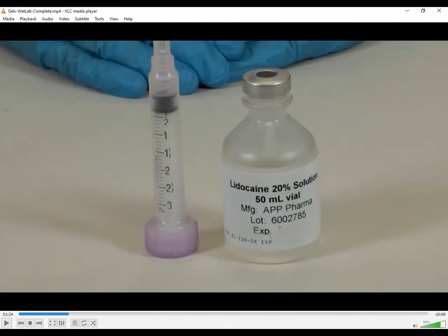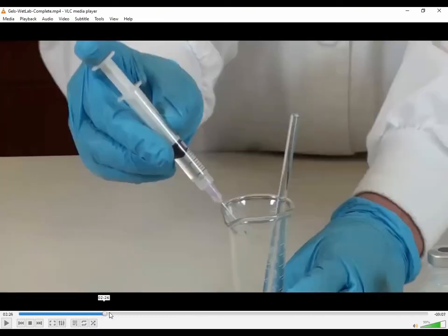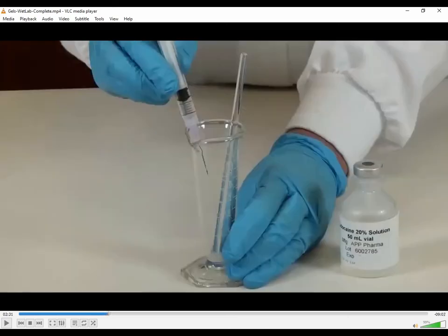You also are going to attach a needle. There is a longer blunt end needle. Attach that needle to the 3 mil syringe and use that to suck up the 1 milliliter of lidocaine solution. Don't throw that syringe away. We're going to need that in a minute, but be aware. So you're going to use the 3 mil syringe, attach a needle, and suck your lidocaine out of the bottle. Now, with your 1 mil of lidocaine, you're going to carefully squeeze it directly onto the acyclovir that's in the small glass conical.